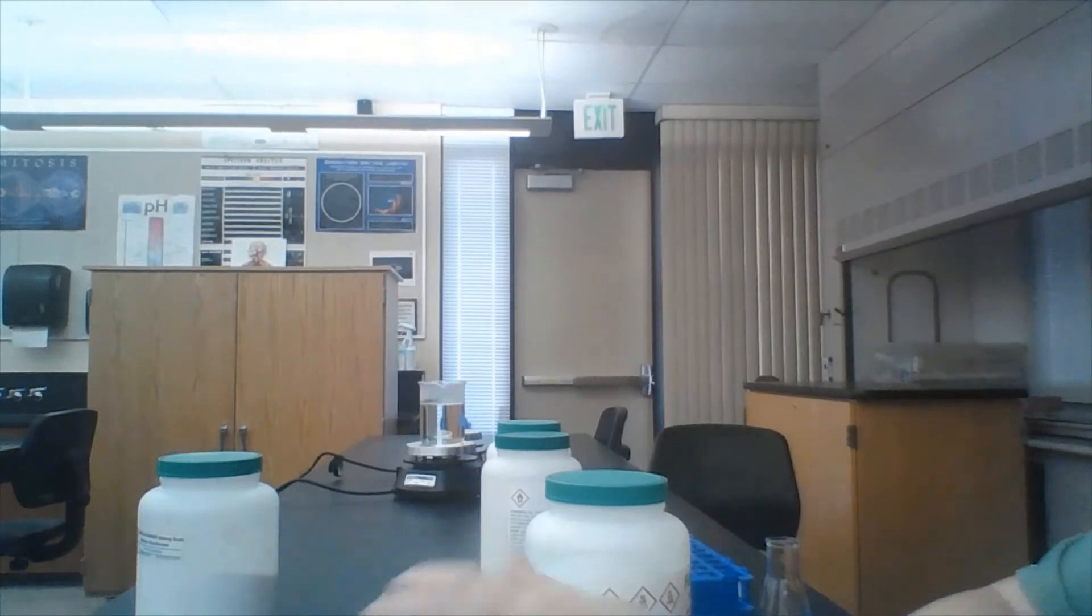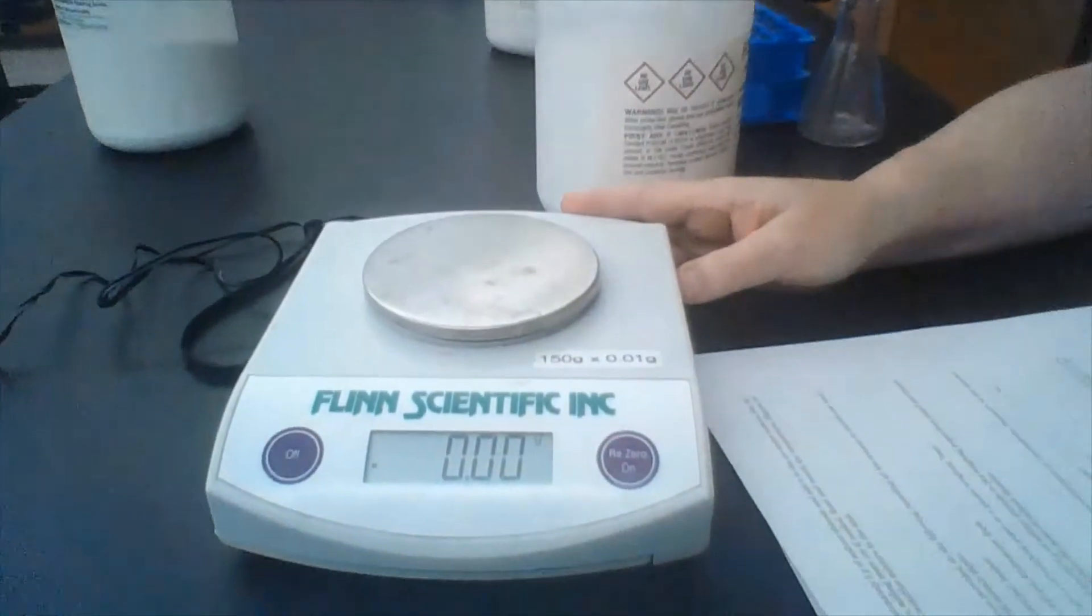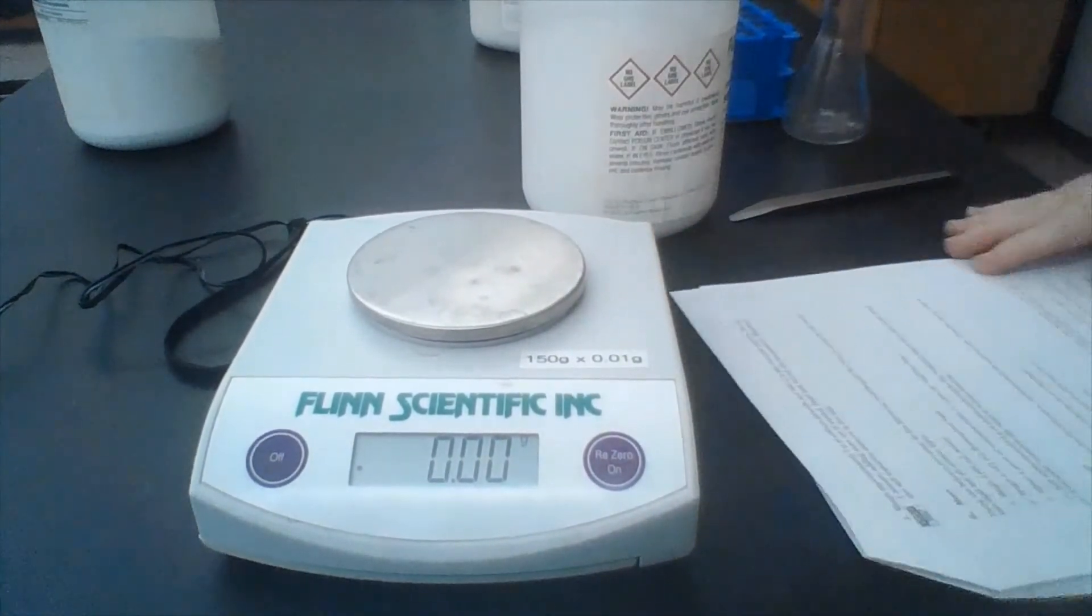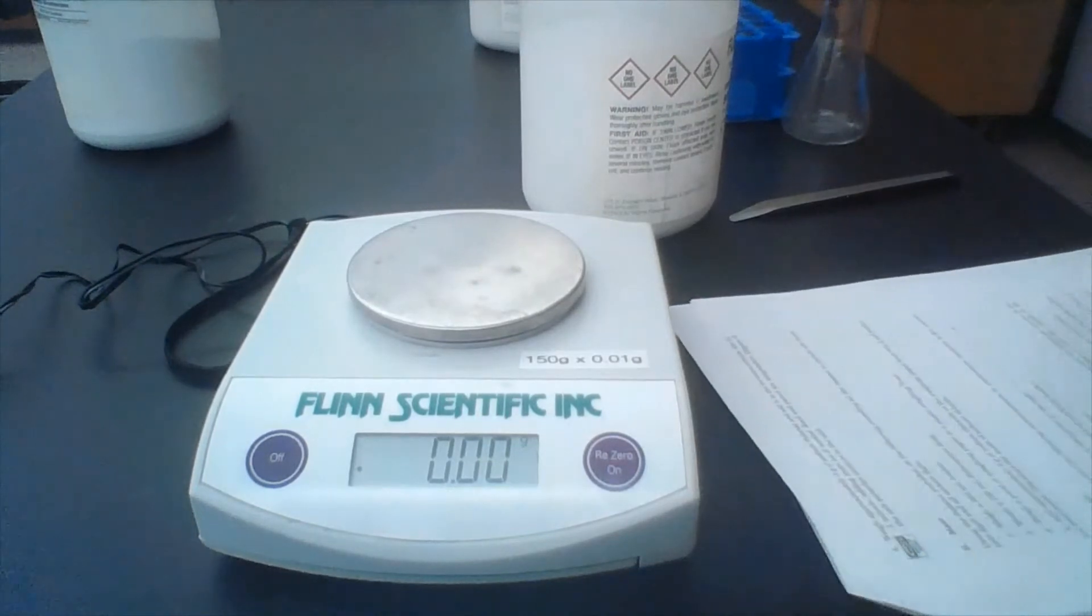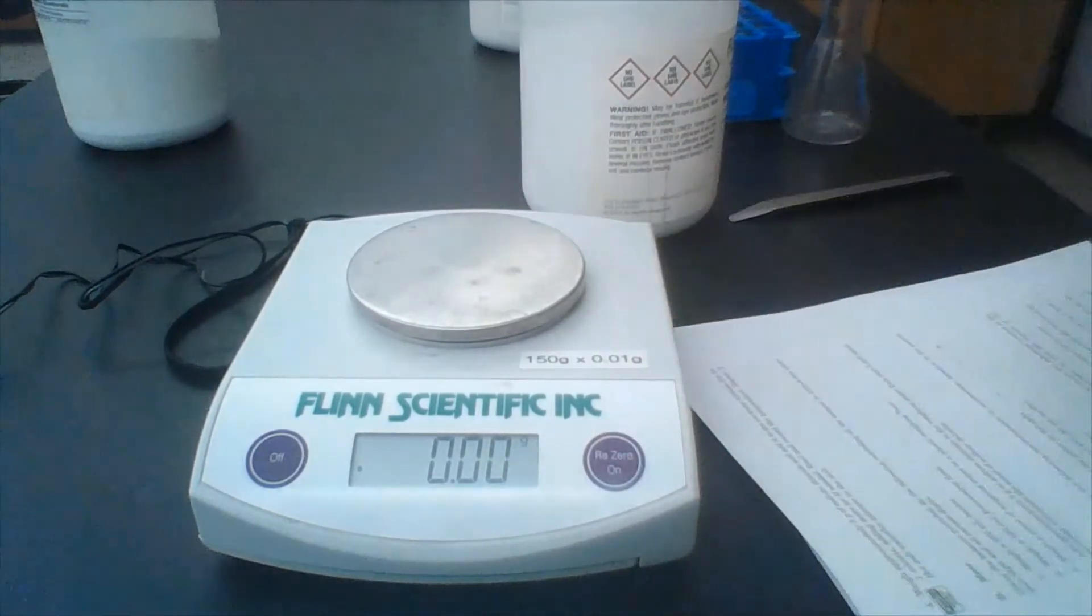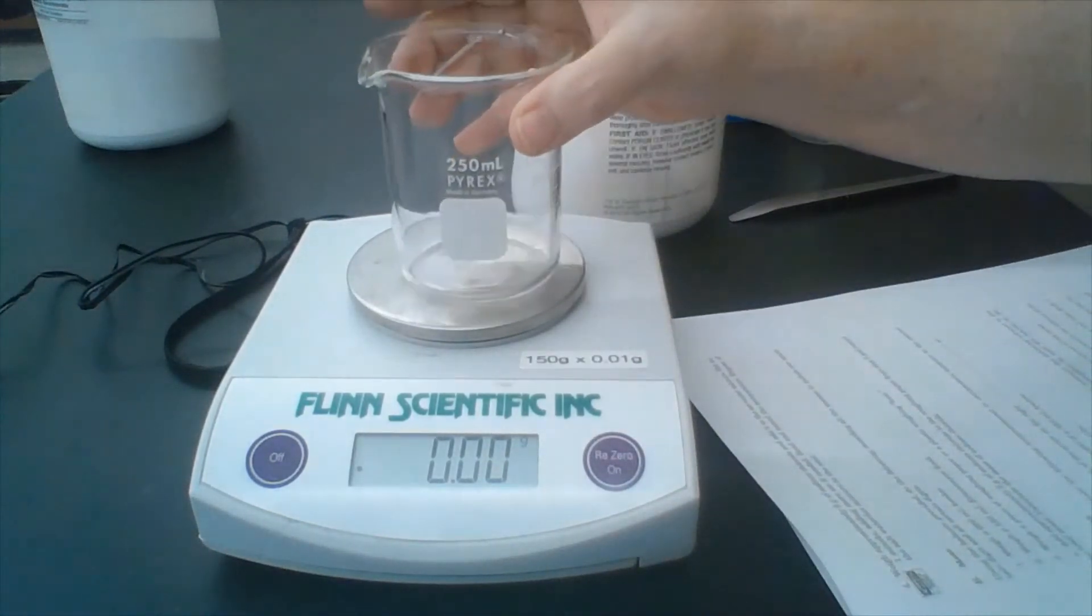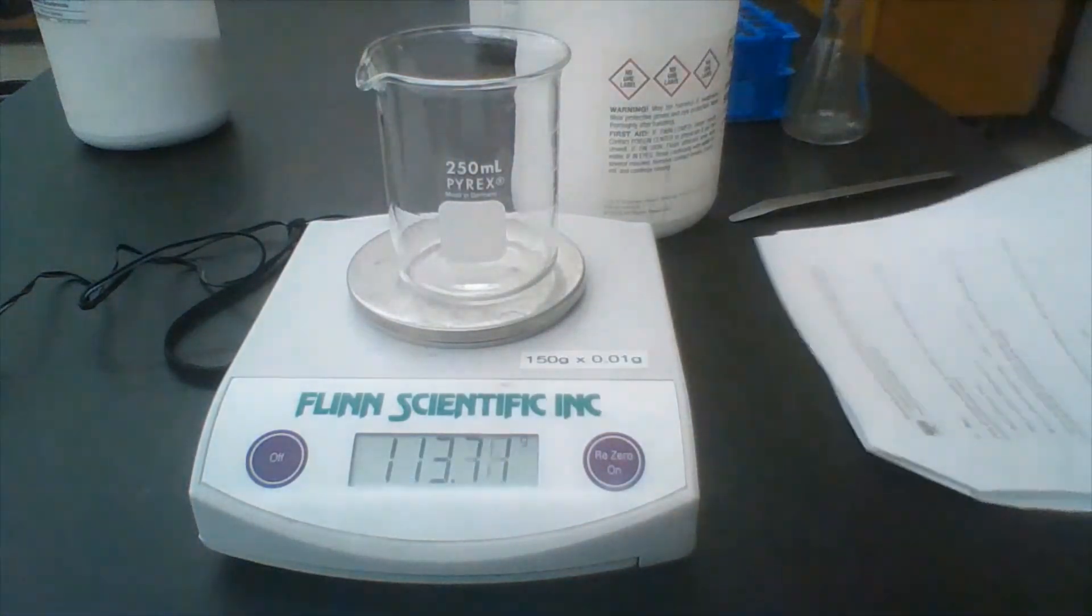For the next part of our experiment, we are going to be measuring mass. So I'm going to put the camera in front of the scale, tilt it down, and let you see that.